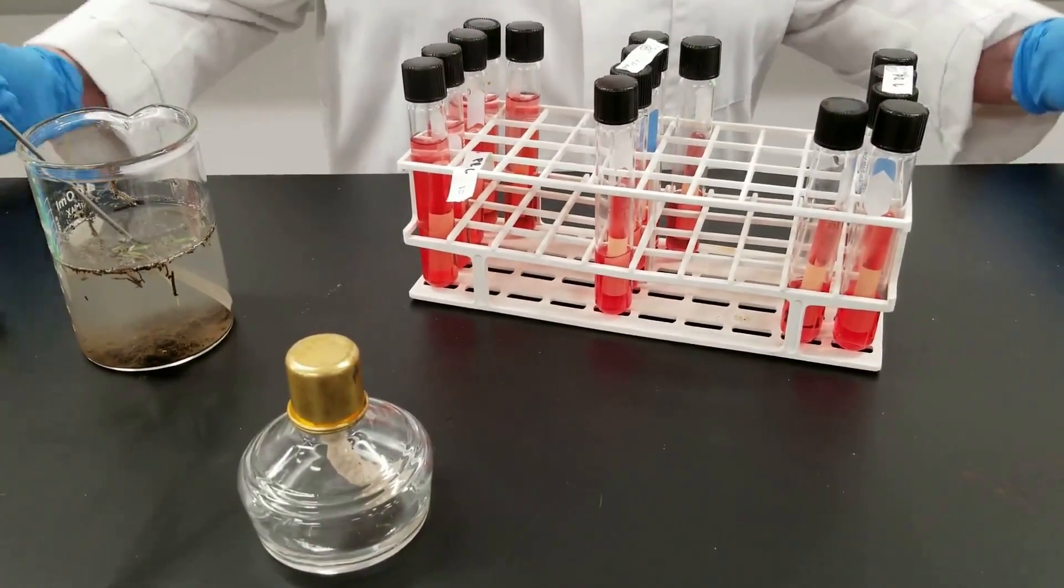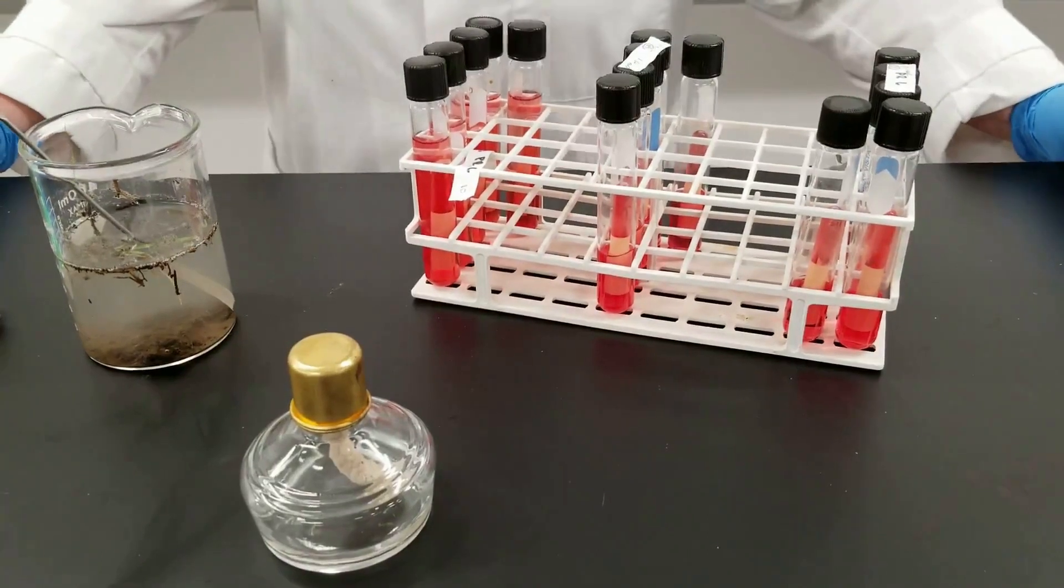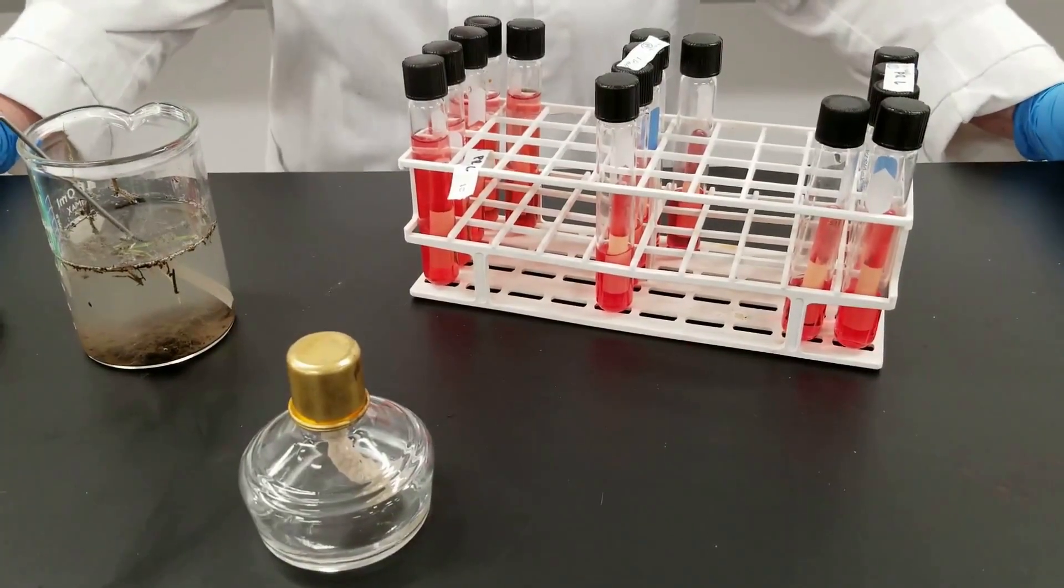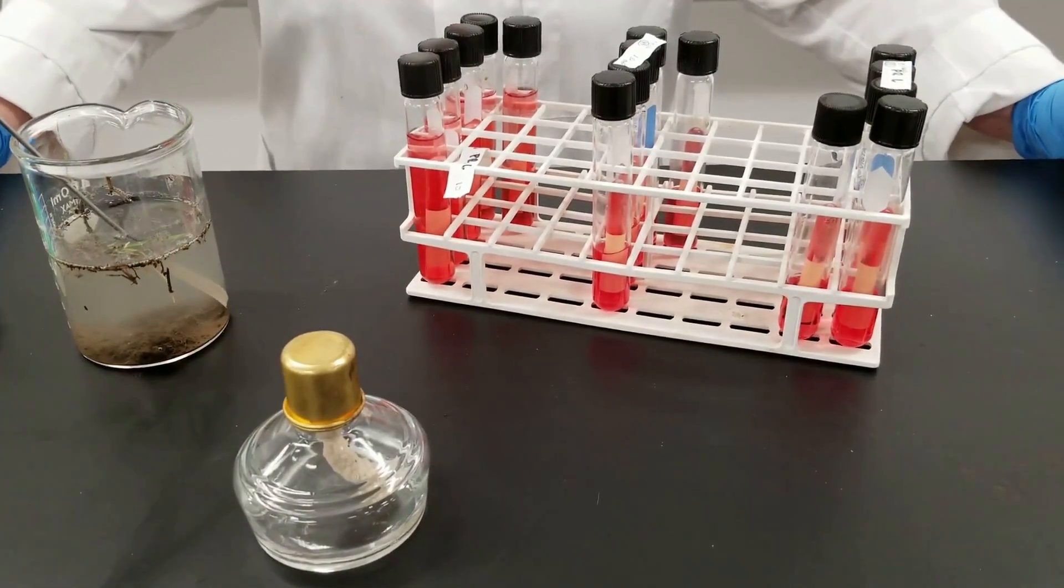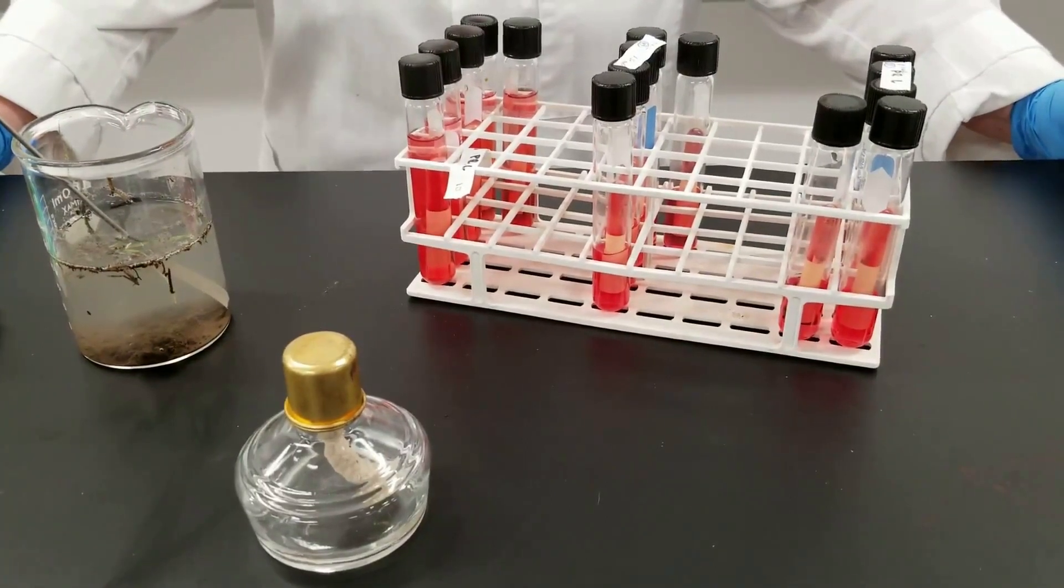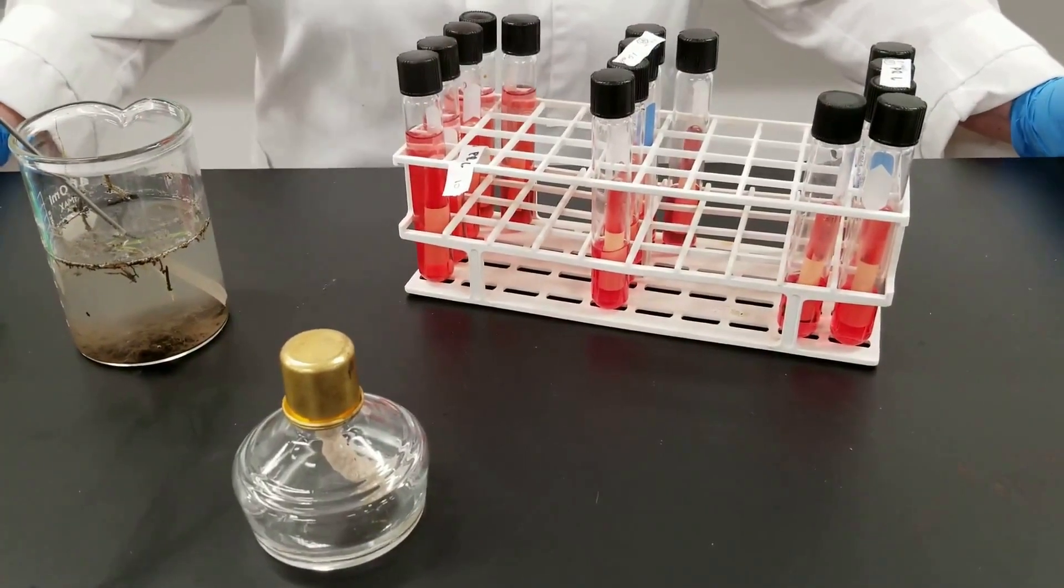This can often be done to determine is water safe to drink, is it safe for recreational activities, or maybe it can be used safe for watering golf courses but not for human consumption.